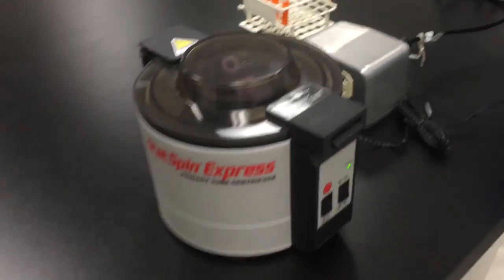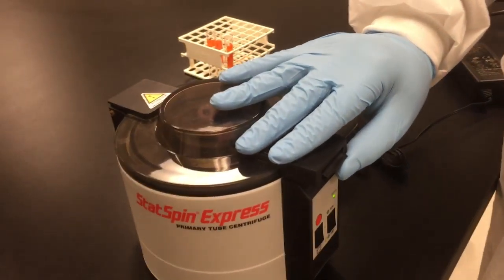Okay, that beep means that it is done and that it is safe to open up the top.